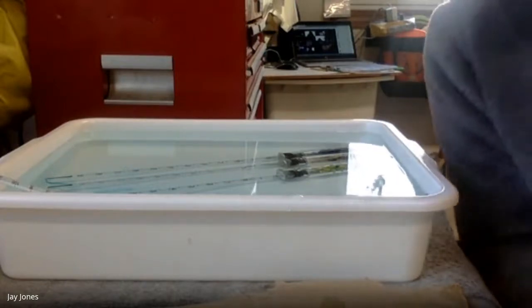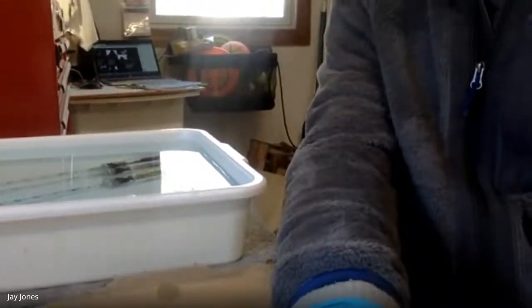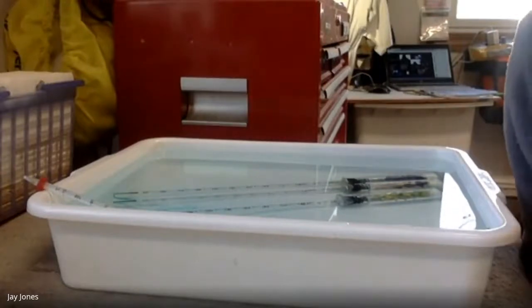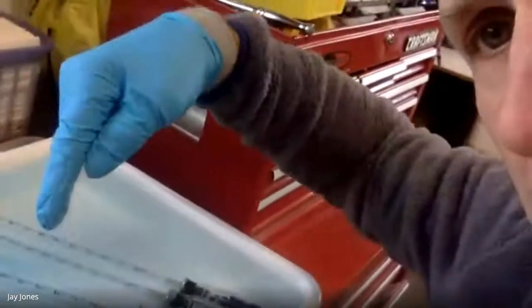All right, we're about to take our 12-minute, right? No, 9 minutes. Our 9. We're about to take our 9. So this is the part of the video where you may want to just fast forward. Or actually, you know what? I could probably pause the video here, right? Because it's going to be the same thing. Yeah, I'll just stop. Once again, to summarize, I'm going to stop the video. But this color, actually, we're going to take it now.